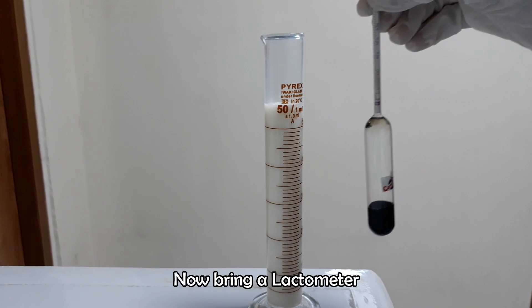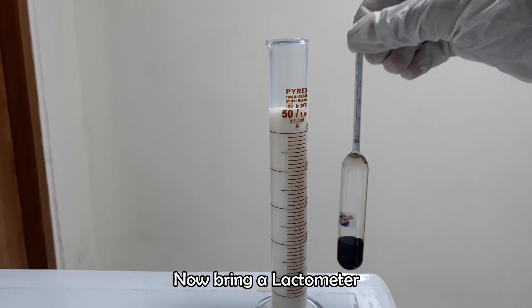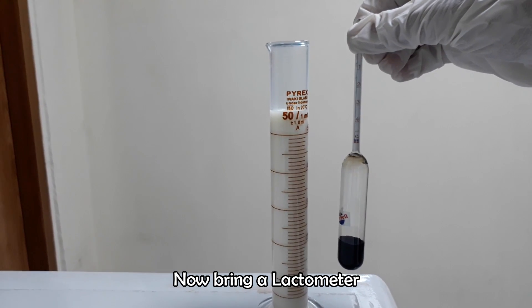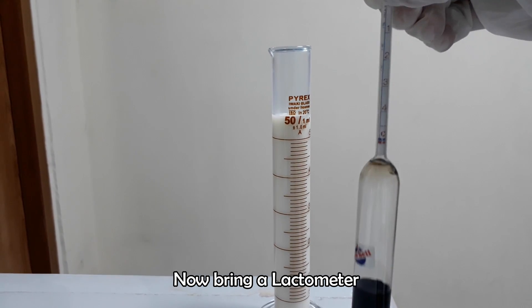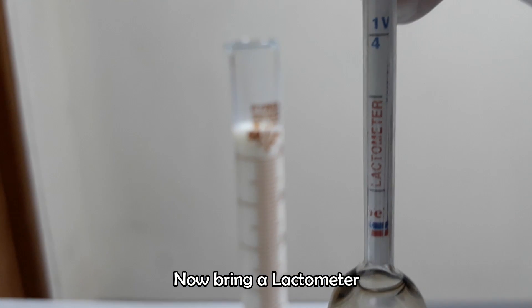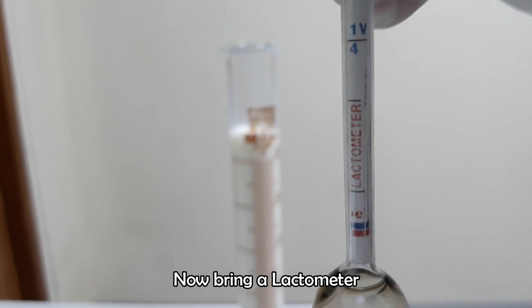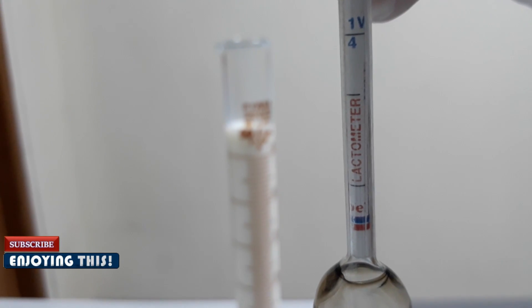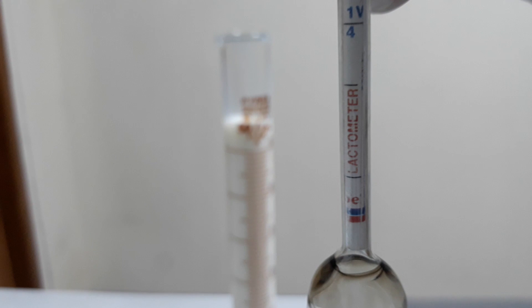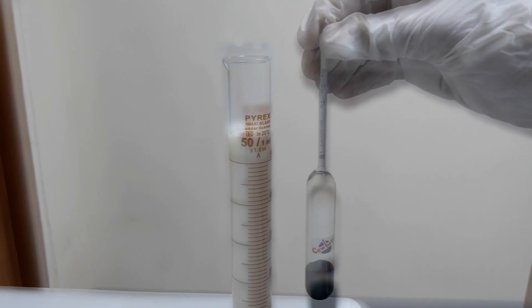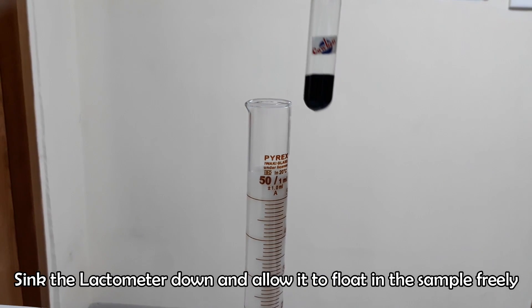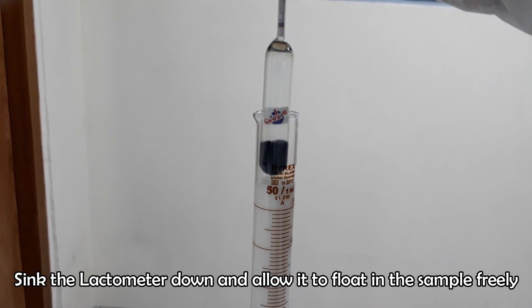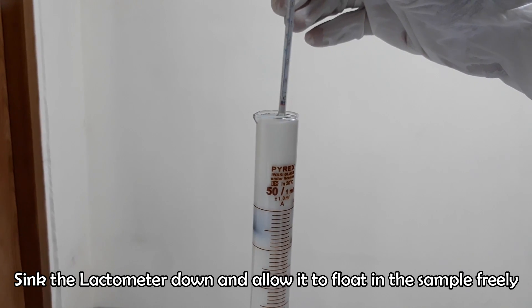Now bring a lactometer. Sink the lactometer down into the milk sample and allow it to float in the sample freely.